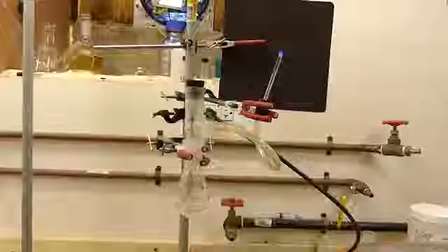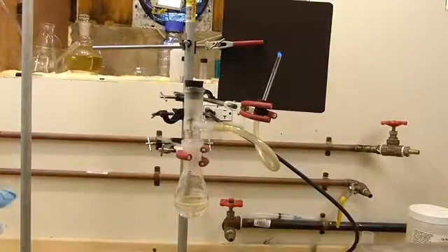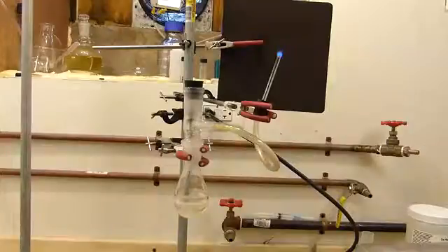The carbon monoxide will now be ignited at the tip of the glass tube, where it burns with a pale blue flame. By heating the apparatus, we can increase the production of carbon monoxide and thus increase the size of the flame. As you can see, this is a very safe and controllable way to produce carbon monoxide.